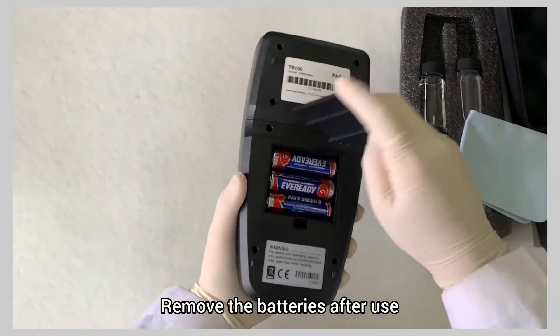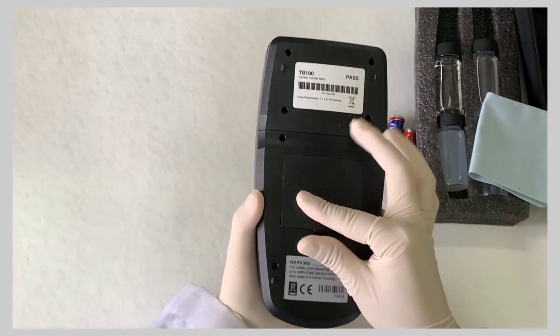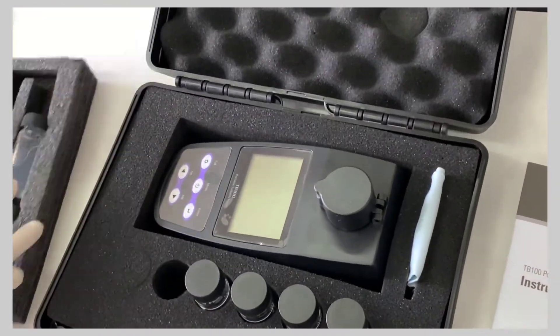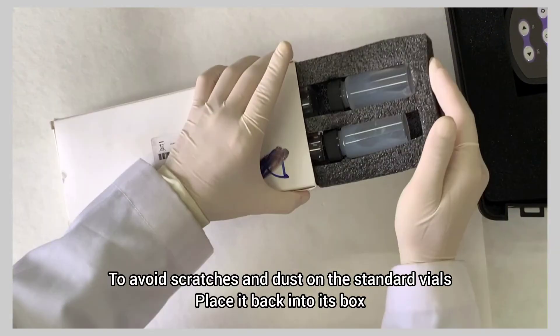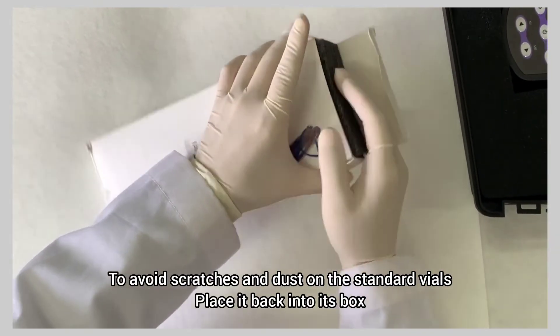Remove the batteries after use. To avoid scratches and dust on the standard vials, place it back into its box.